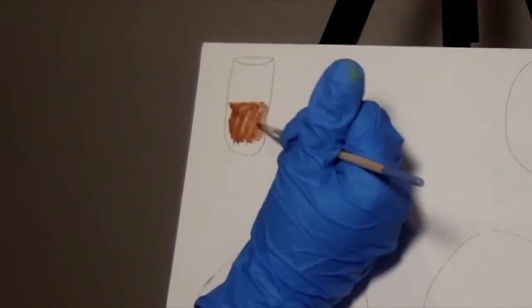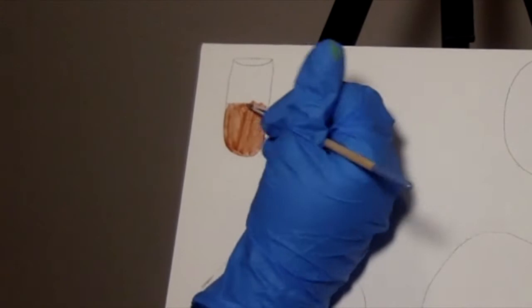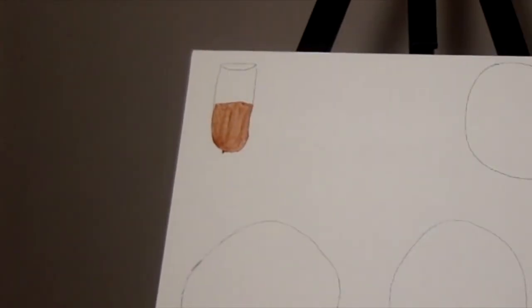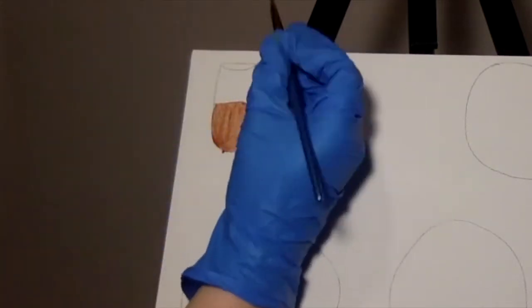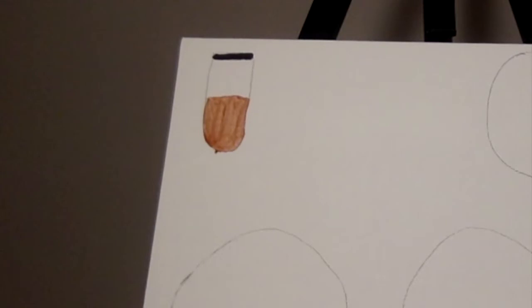Let's get into it. So first we can measure our oxygen requirements of our S. aureus. We can do this by filling a tube with thioglycolate and inoculating that with our S. aureus. Then we can put a cap over top of the tube so that nothing else can get in it, and we can see that our S. aureus will grow in the solution.